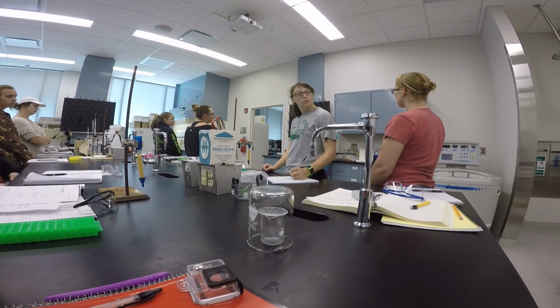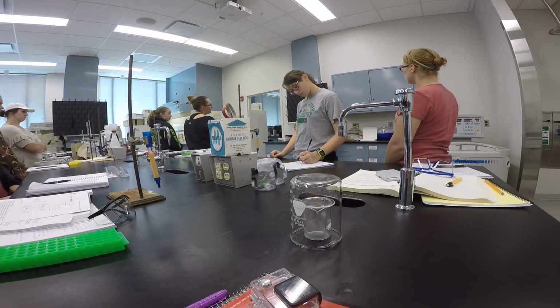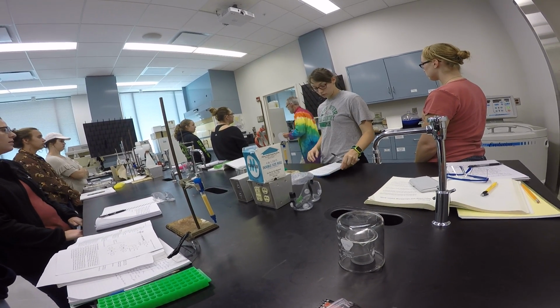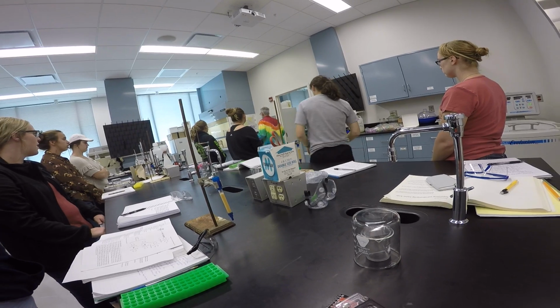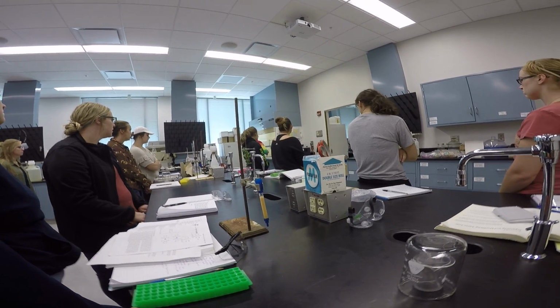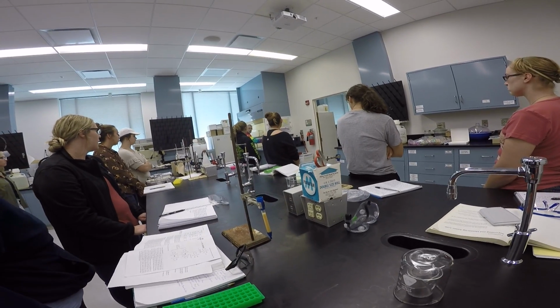And when you get all 15 fractions on there, you take it over there in the hood and you simply spray it. Okay?